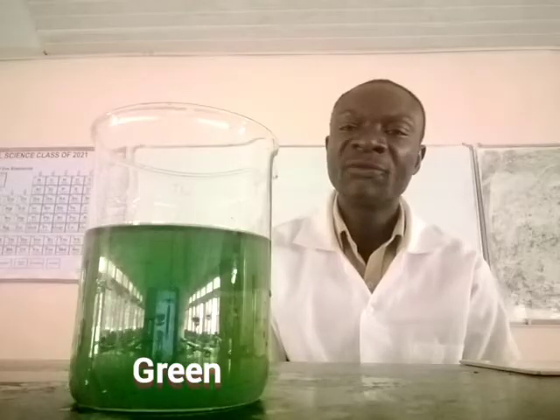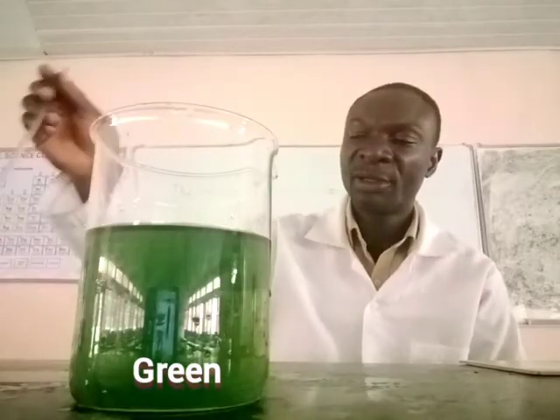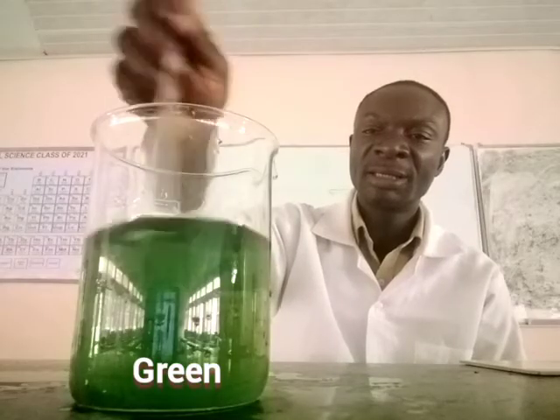Now this process will be faster if some level of stirring is applied.